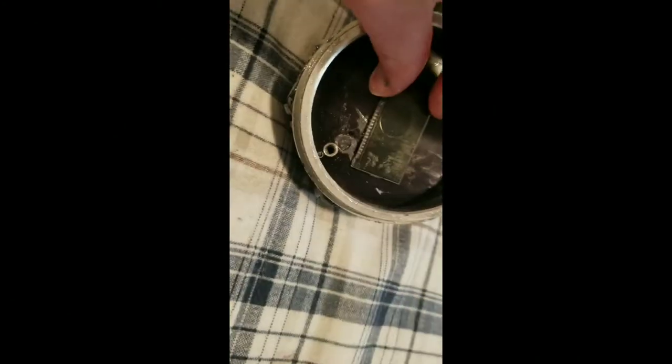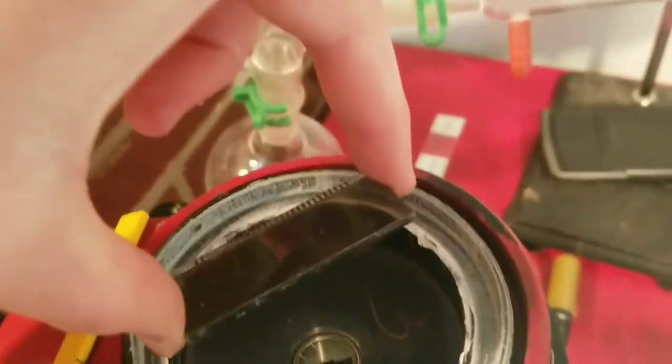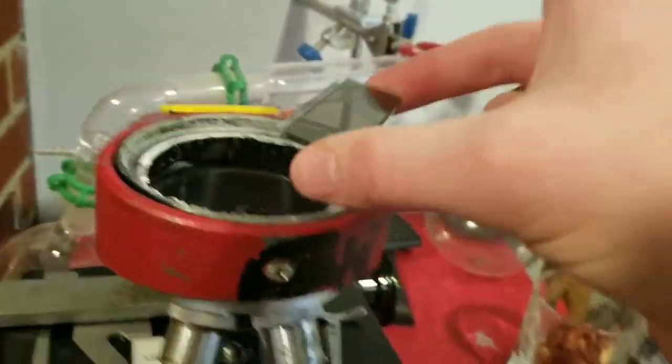I think I'm going to pick this one right here. It's going to be taped into this position. And I'm going to clean it with some alcohol first, though. You can see this is the point where it goes black. So I'm going to want to tape it on, like, there. If this was facing... There we go. If this is facing frontward, I'm going to want it like that.